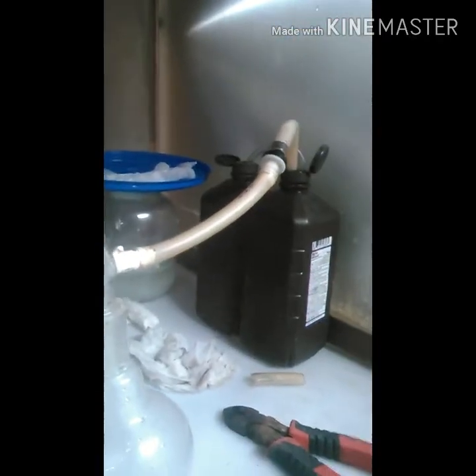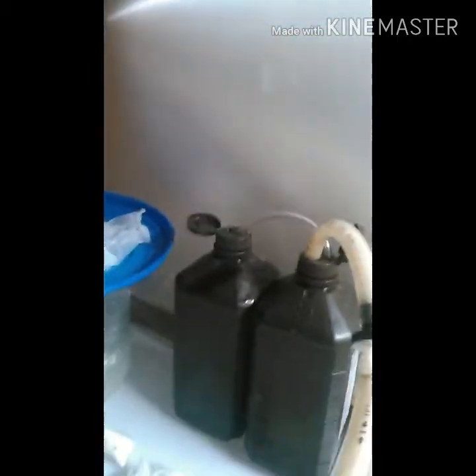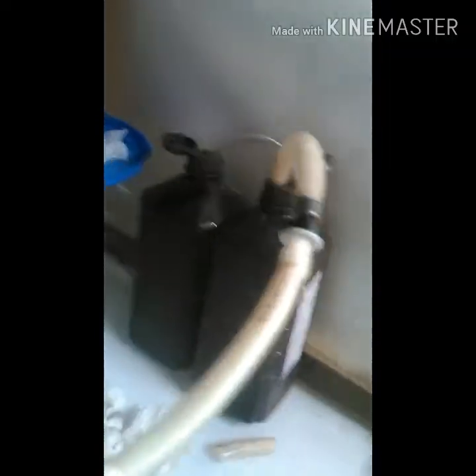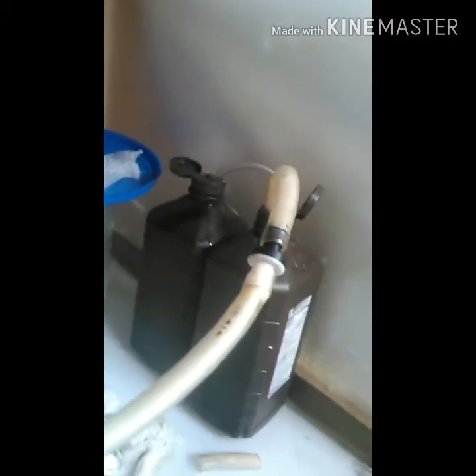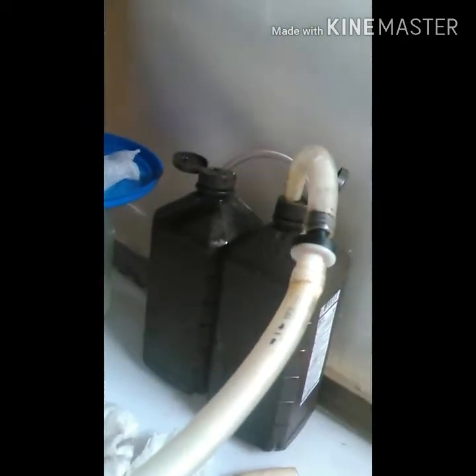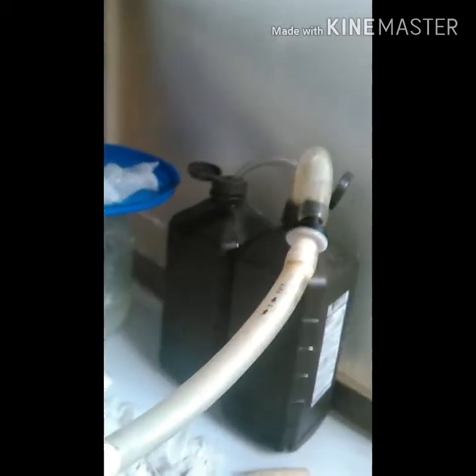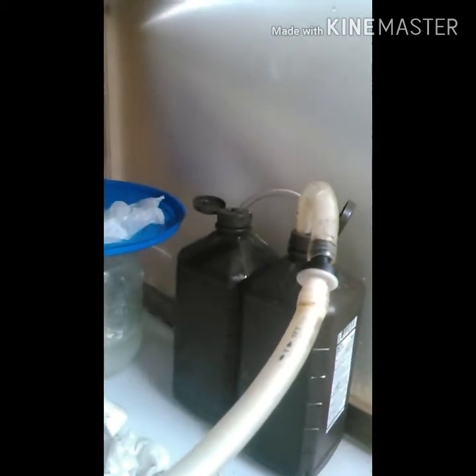I felt like it was starting to percolate too fast, so I made a double percolating apparatus, so that way if I'm missing any of the gas, it'll have another chance to percolate again in the other container. That way I'll catch more. I figured I'd show that to you, because the way I had it was not adequate — you could definitely tell I was losing gas.